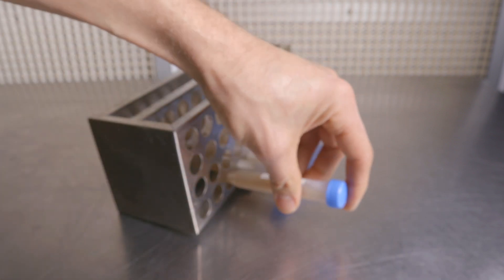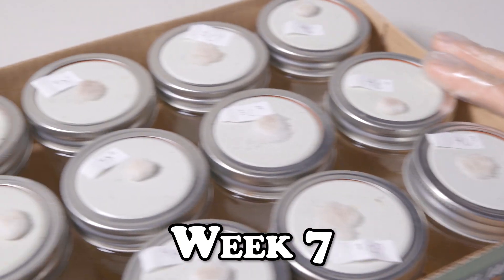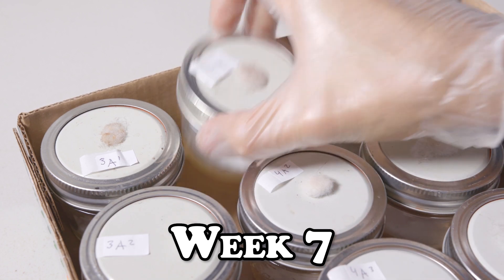Either way, these agar slants are going to work flawlessly. Now it's time to have a look at our fourth round of isolation and see how we're doing.